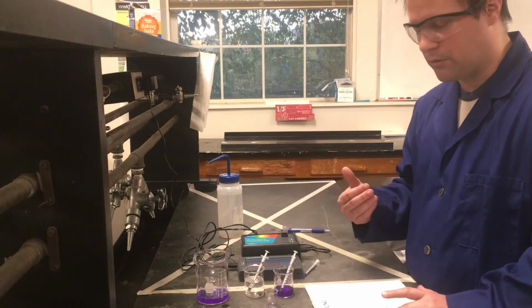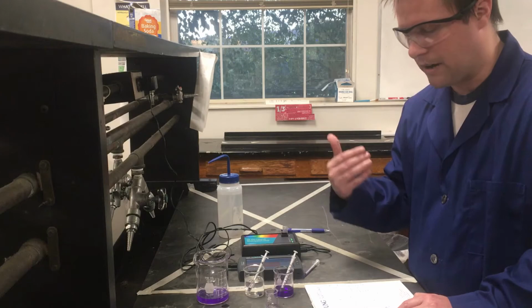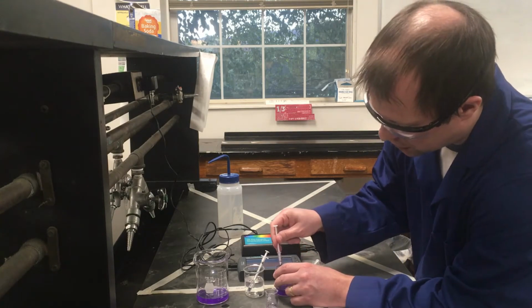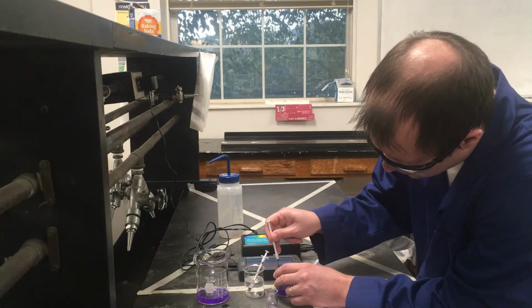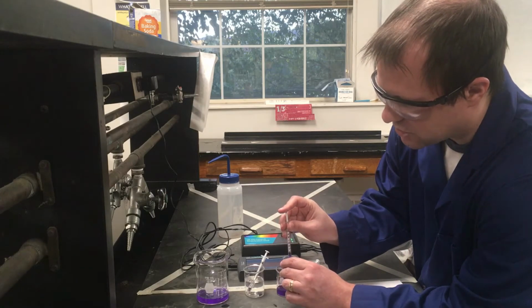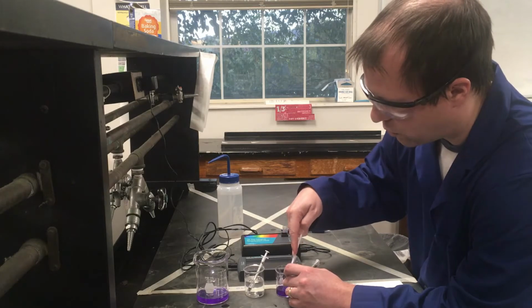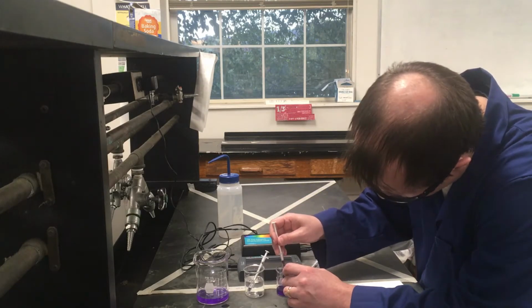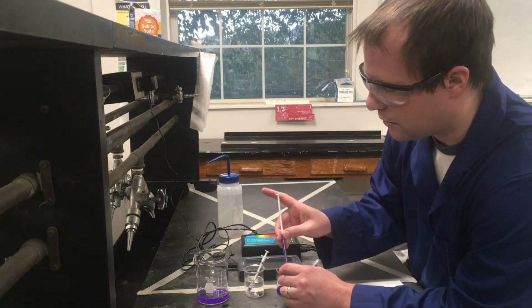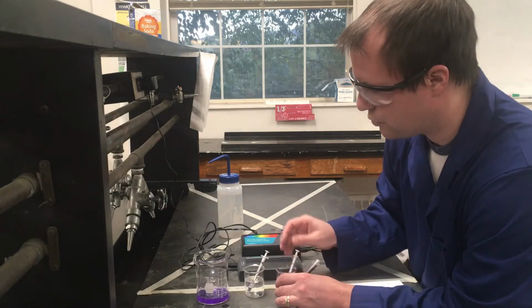All right, so the next solution I'm going to make, I'm just going to work my way down the list. Next concentration was 1.75 × 10^-5 molar. If we do our calculations for this dilution, it turns out I should need about 2.1 milliliters of my stock solution, the crystal violet. And I need my total volume to be 3 milliliters, which is what's happening for the calculations for all of these for this part of the experiment. Our final volume is 3 milliliters, just because about 3 milliliters is enough to basically run 2 samples in your cuvette if you really need to.